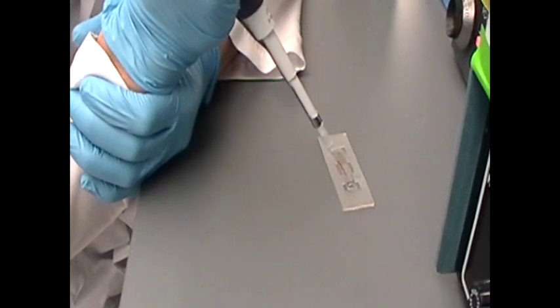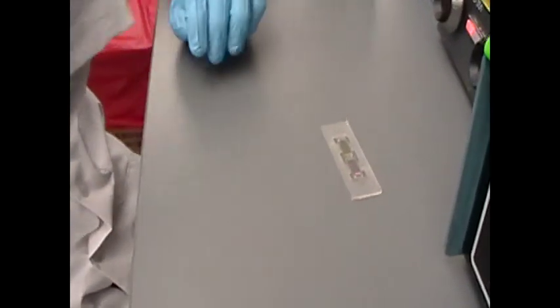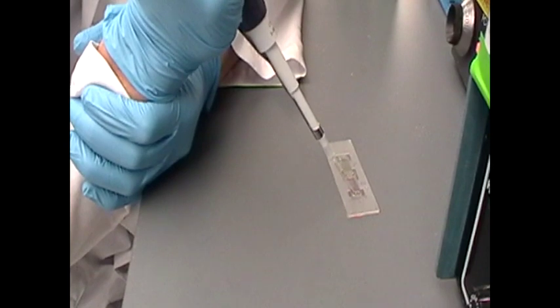Next, using a clean pipette tip, draw up 10 microliters of your sample and expel it into the sample loading area. Once the hemocytometer is loaded, it is time to count the cell sample. Do not wait too long before counting, or the sample will start to evaporate, pushing the cells together and changing the density. You will know this is happening if your cells begin to move under the microscope, or if you see air bubbles. Stop counting, load the second sampling area, and start again.